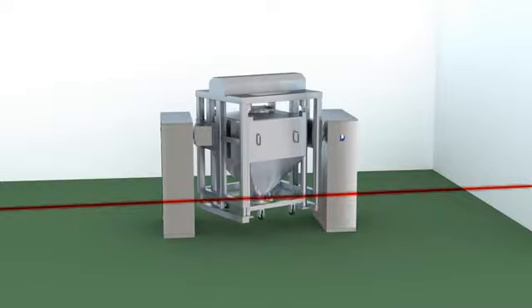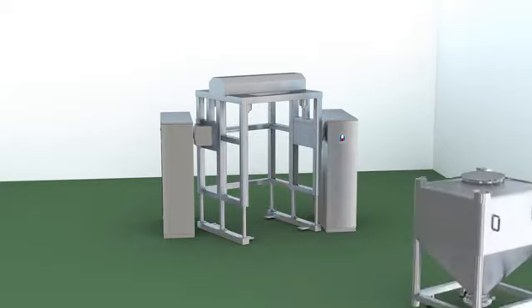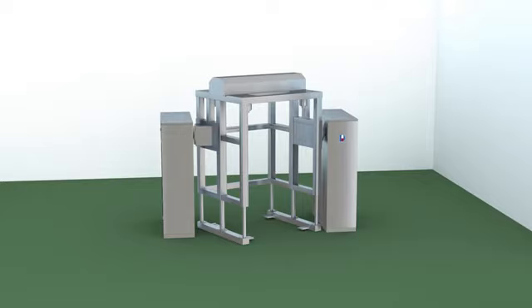After mixing, hopper will be in position vertically and automatically. Lower the hopper on ground and push the hopper to next procedure.